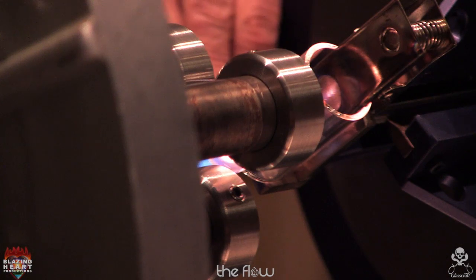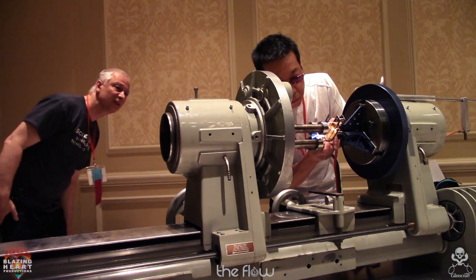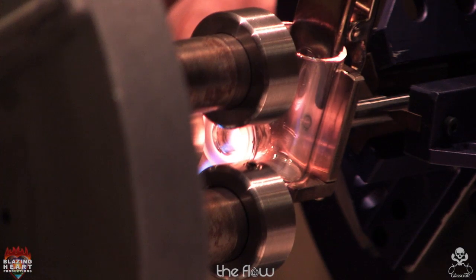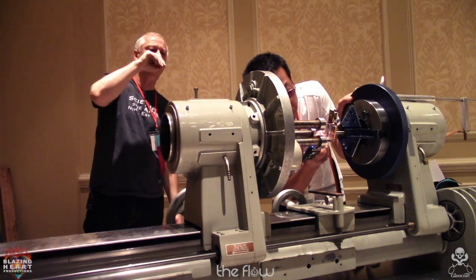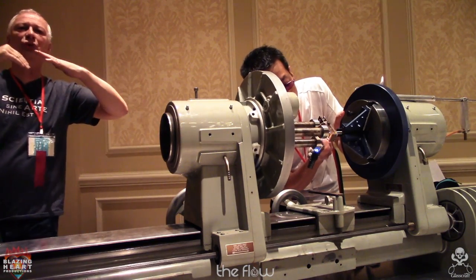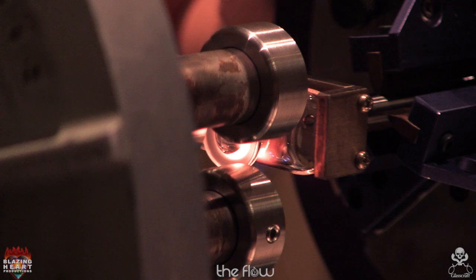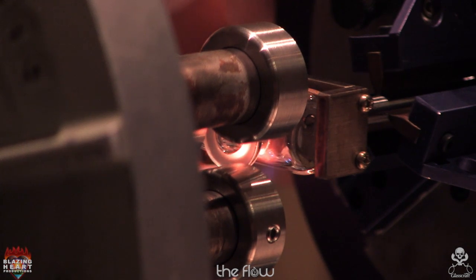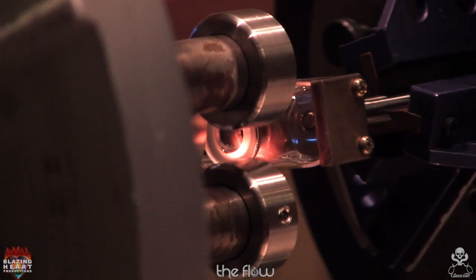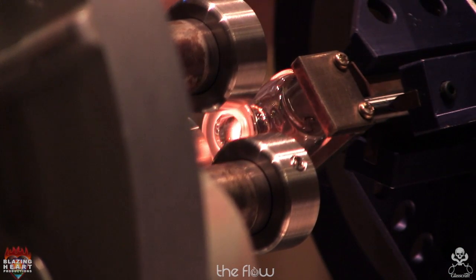He's probably running from maybe 8 o'clock down to 5. And again, let gravity kind of sag the soft stuff out to get a nice radius formed. And you actually need sort of 2 different diameters of radius because of how close these tubes are. So the top and bottom is going to be a slightly sharper radius, and then the side walls are going to be a little bit bigger.